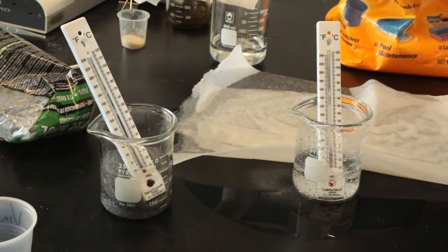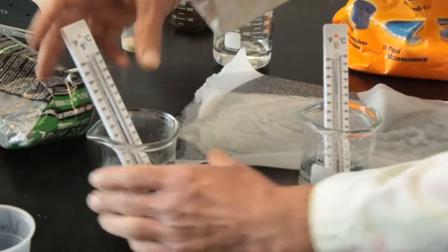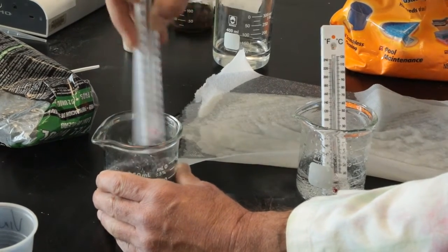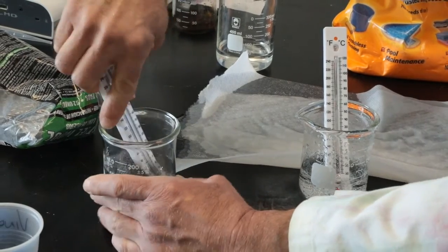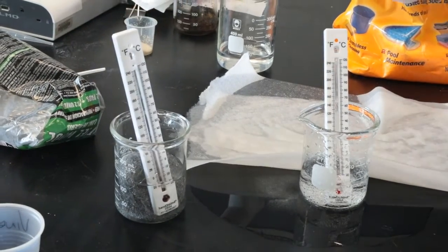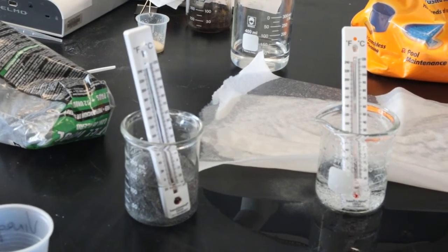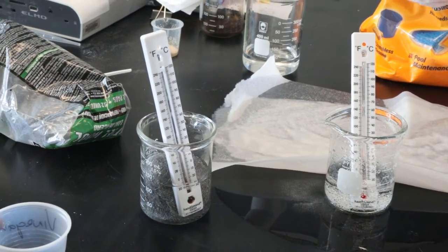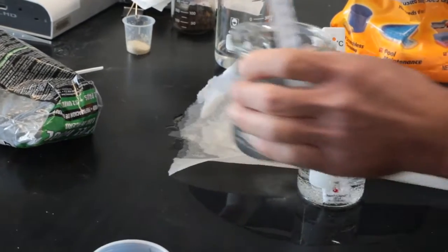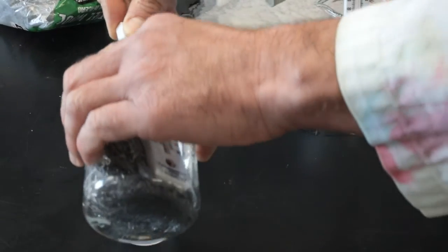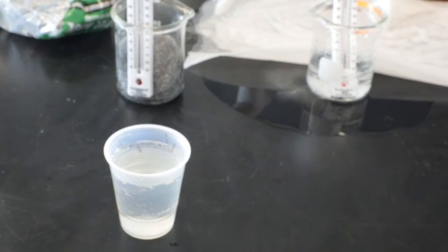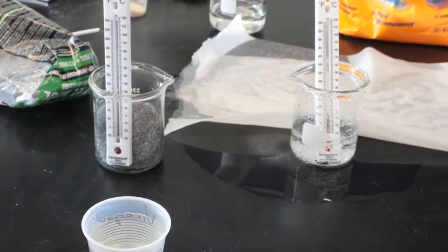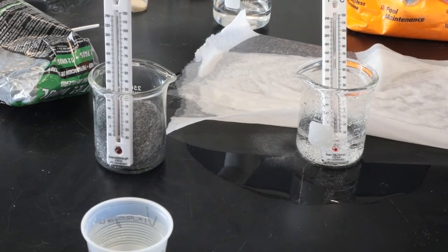So now we're going to go back and switch the steel wool around again. Because you've only got one thermometer, you're going to have to do this in two different steps. We get to do it at the same time. Dave's going to pour off the acetic acid into a separate cup. Now we're going to leave the thermometer in with the steel wool and cover it up with a towel and let it set.